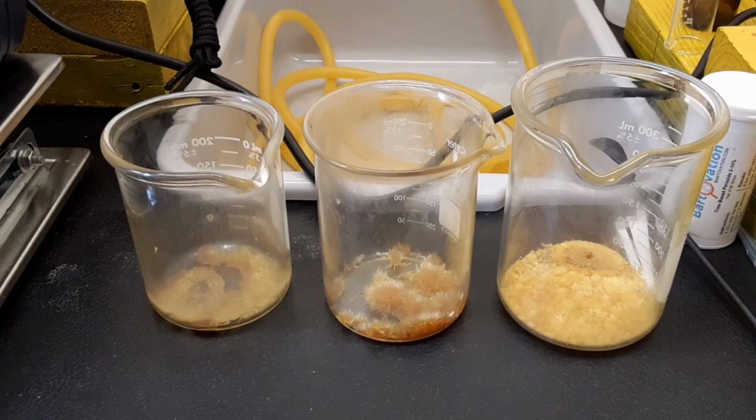What it means, I don't know. I don't know the method to the madness. But you can bet your behind I will try this again. Maybe more than just once here in the future. And try to figure this out. I think beyond a shadow of a doubt, I will never ever try to use black pepper again. It gives you the illusion that you're going to have something great. And then it says, nope, not going to happen. So the white pepper is definitely in, the black pepper is definitely out. That's the only conclusion I can make after weeks of doing extractions.